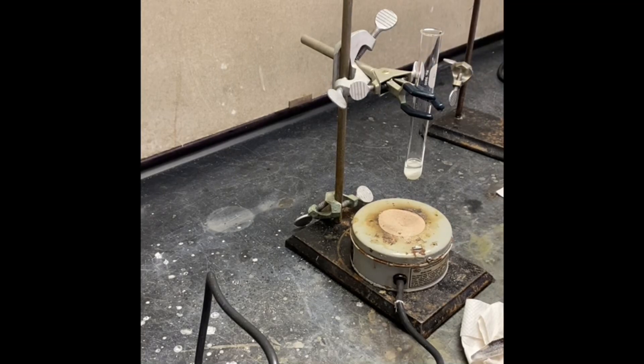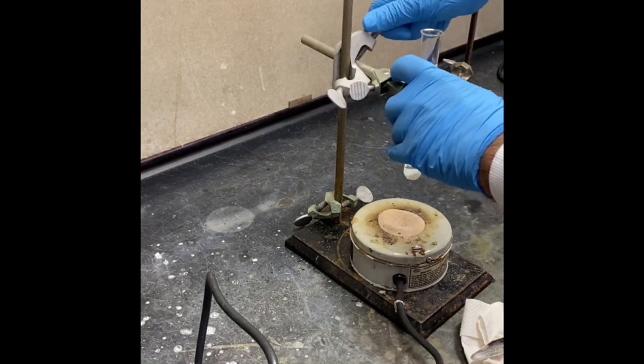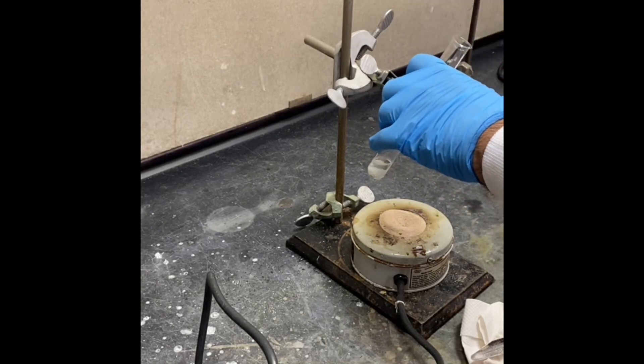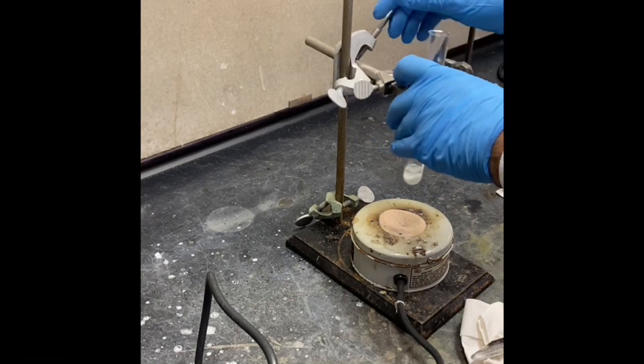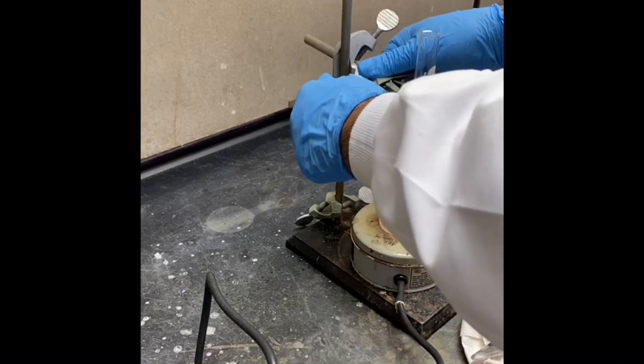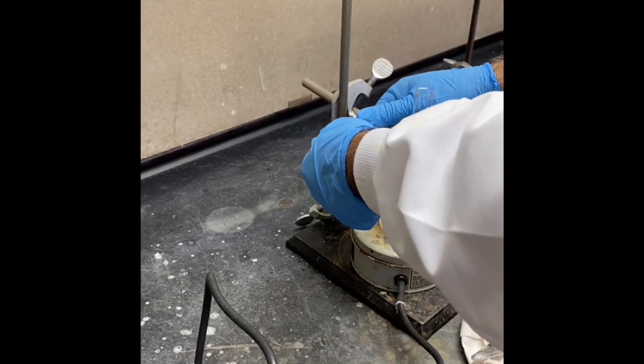Before doing that, we have to make sure we put one boiling chip in. Boiling chip is in, and it looks like the 3-nitrophthalic acid dissolved.